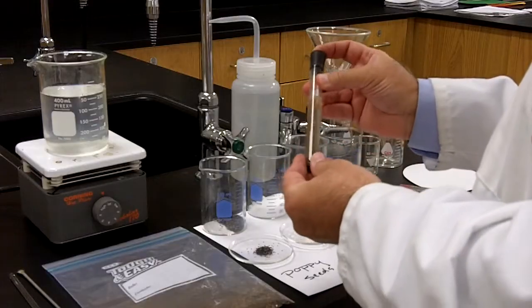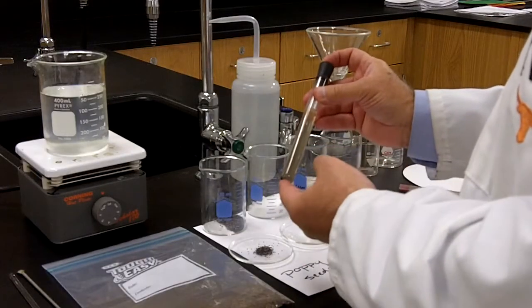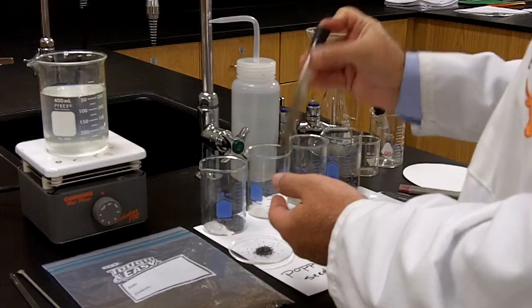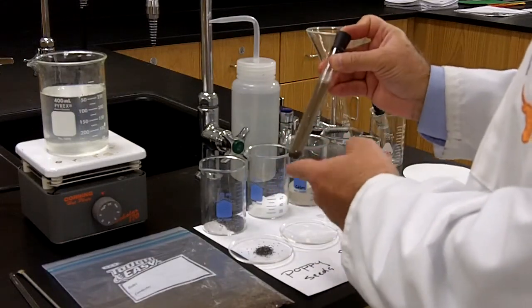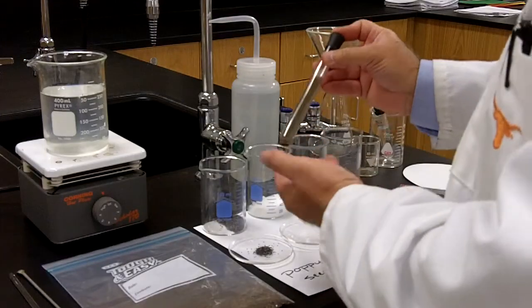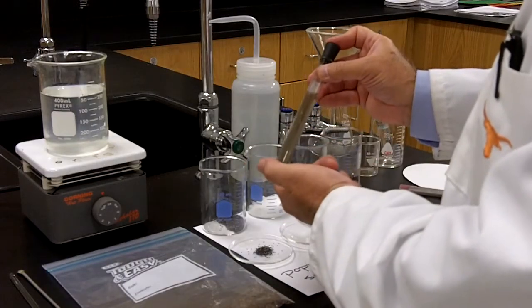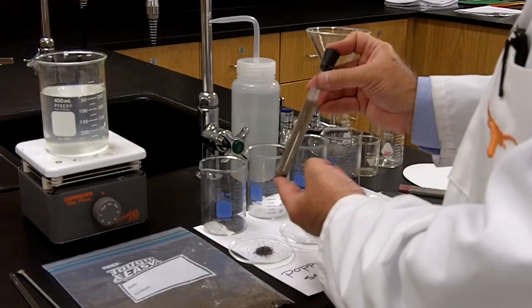So let's contrast that with the contents of this test tube. I've taken some water, also almost 100 degrees Celsius, and this time I've placed, instead of salt, iron filings into the water. As you can see, even if I shake the iron filings pretty vigorously, the iron filings eventually are going to make their way back down to the bottom. So this is not a homogeneous mixture. It's not the same throughout. Obviously, there's more iron filings on the bottom than on the top. Eventually, all the iron filings will fall down. This is not a homogeneous mixture. This is a heterogeneous mixture.